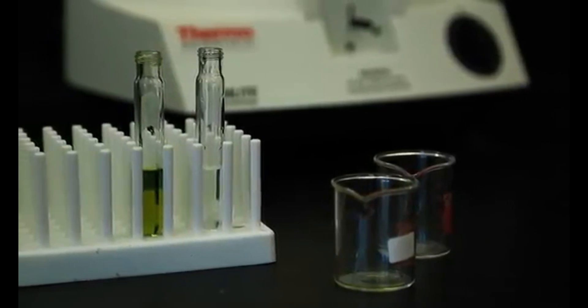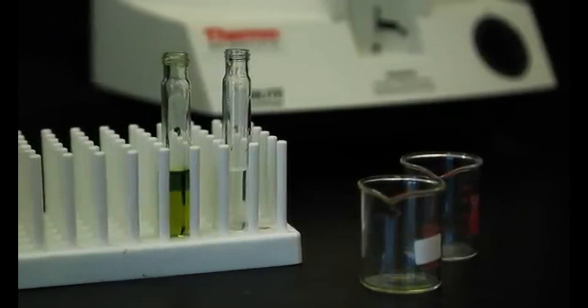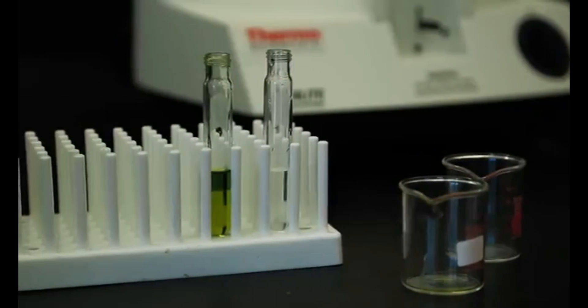It is very important that each test tube has another test tube placed directly opposite it in order to keep the centrifuge balanced.